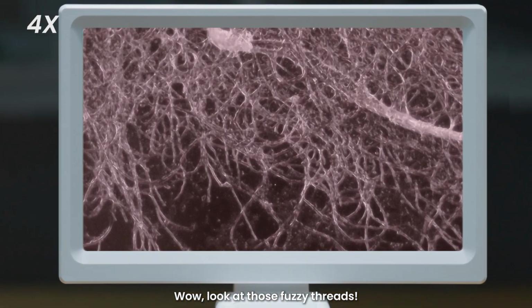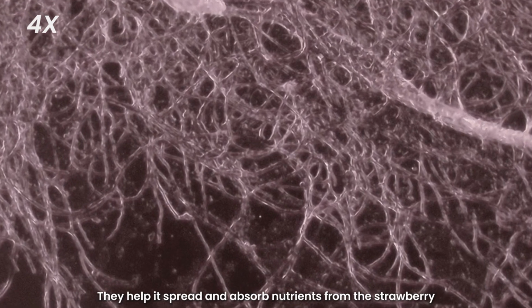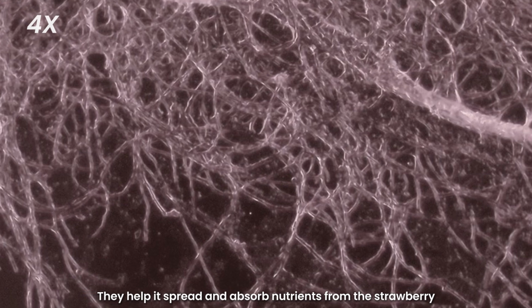Wow, look at those fuzzy threads. Those are called hyphae, and they're like the roots of the mold. They help it spread and absorb nutrients from the strawberry.